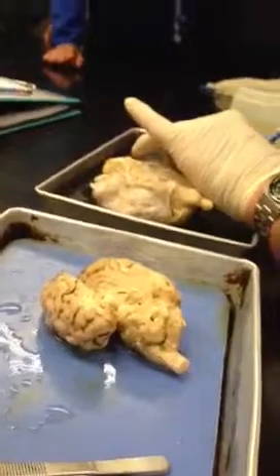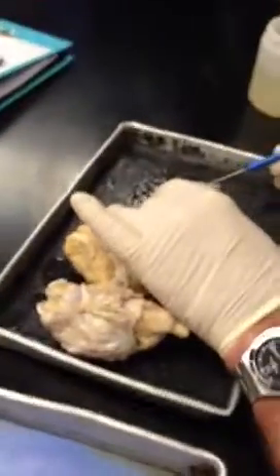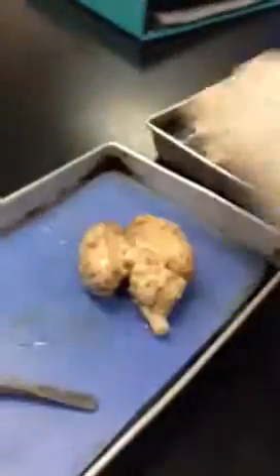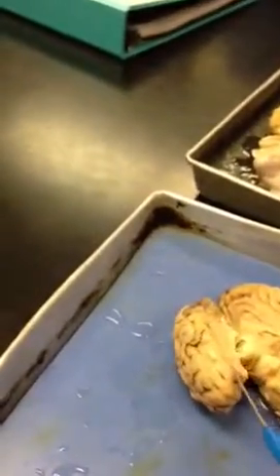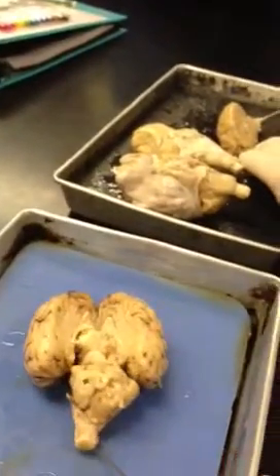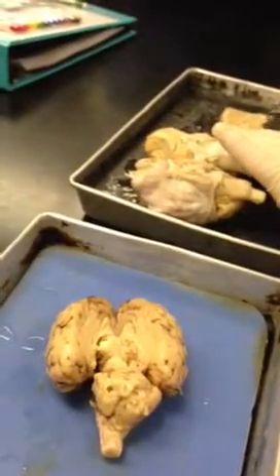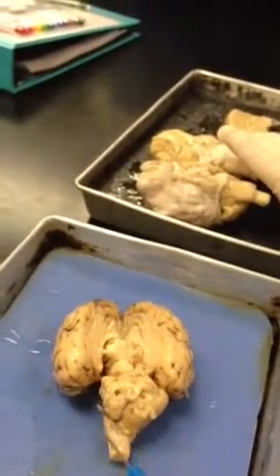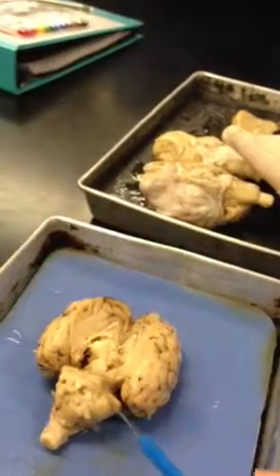So tree of life. You can see right at the base of this has gotten a little funky here, right here at the base of the cerebellum. Anyway, there's a little hole, kind of gap right there. That's the fourth ventricle, right at the base of the cerebellum. And then this little slit right there is the cerebral aqueduct, right? But we cut it in half, so it doesn't look like much. And as we move up this direction, this bulge right here is the pons. This would be the medulla oblongata, and then this would be the spinal cord.